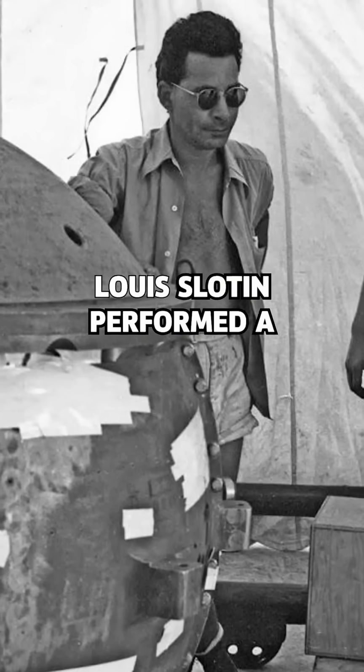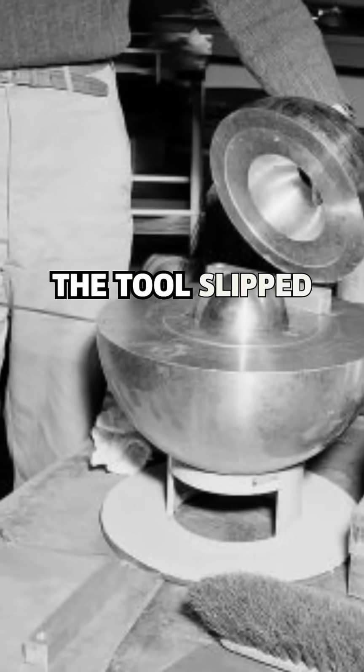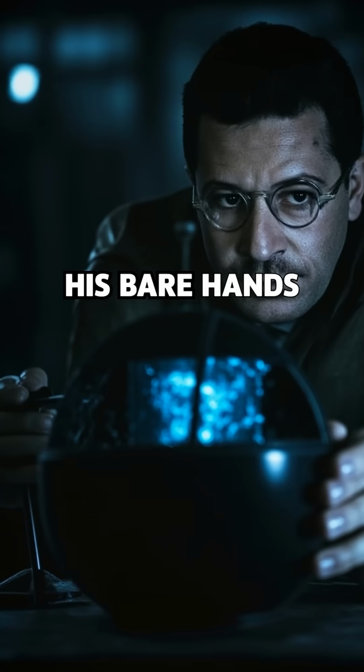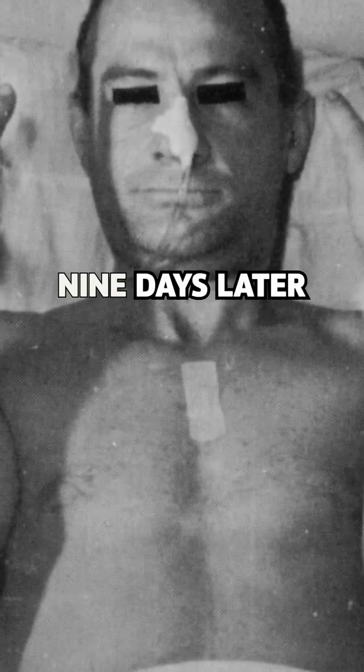May 1946. Just 9 months later, Louis Slotin performed a risky hands-on demo, using a screwdriver to separate the core from a beryllium shell. The tool slipped. The shell fully enclosed the core. It went critical again. Slotin pried it apart with his bare hands, saving his team, but absorbing a fatal dose. He died in agony 9 days later.